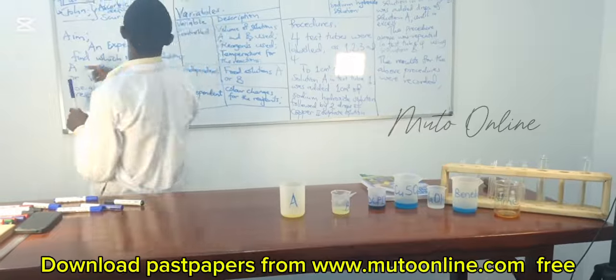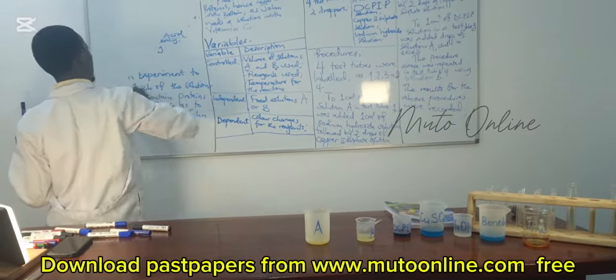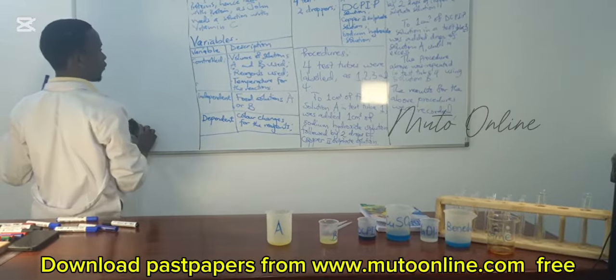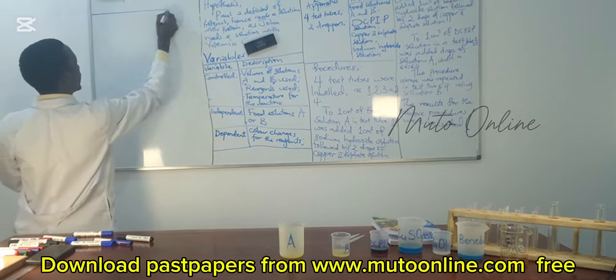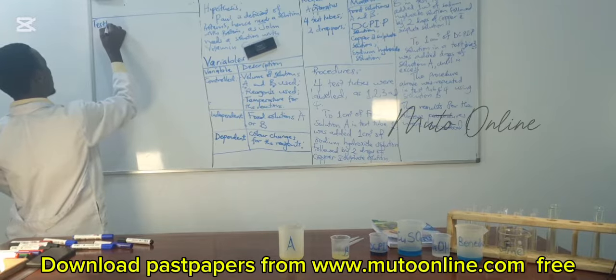So the next step is you giving the results. And the results for food tests, we know them very well. We give the test, and which test now are in test tubes.